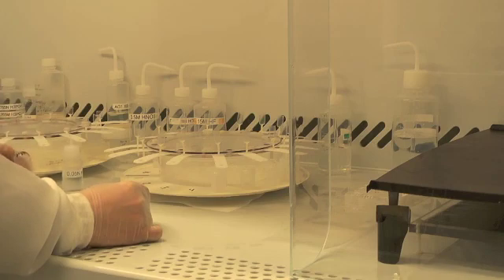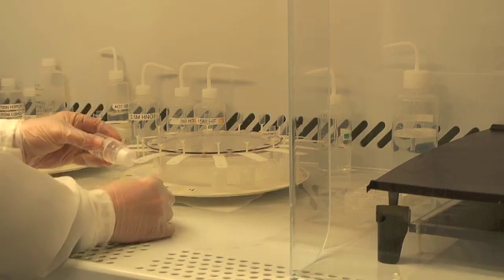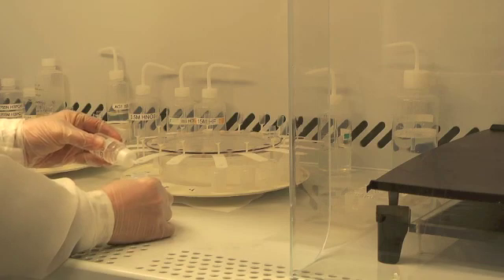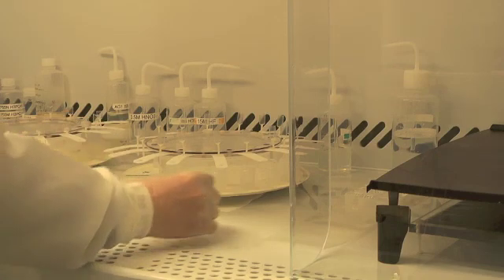I simply remove the beaker from under the column, deliver a small drop of phosphoric acid, and place that beaker on the hot plate to dry down.